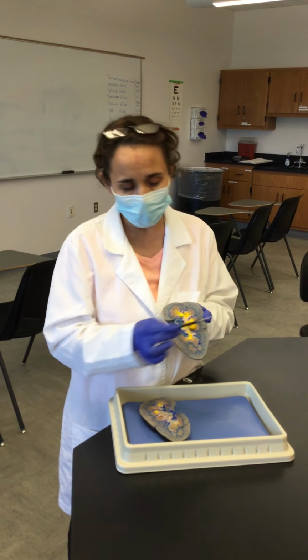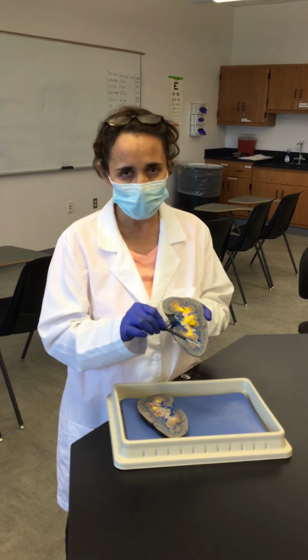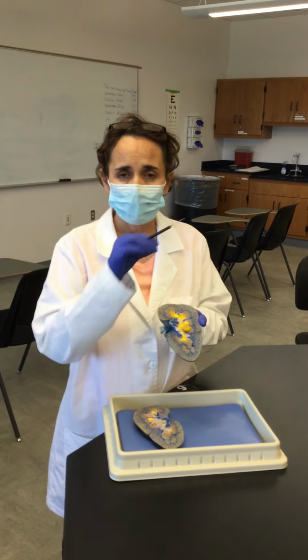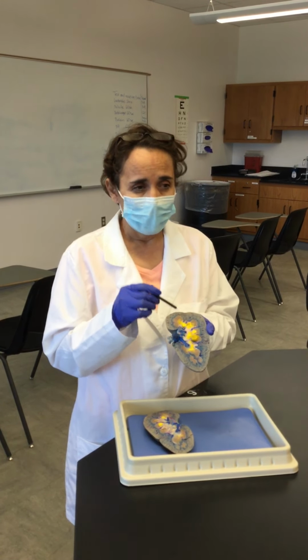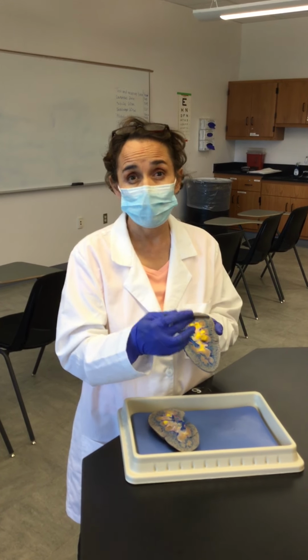And then the arcuate are going to form branches that go radially toward the cortex that are going to be called the cortical radiate. And then from the cortical radiate, you have a tiny branch that is called the afferent arteriole or arriving arteriole, that inside the nephron, the renal corpuscle, is going to form a net of capillaries that we know as the glomerulus. And then the glomerulus is going to empty its blood into the efferent arteriole or exiting arteriole.